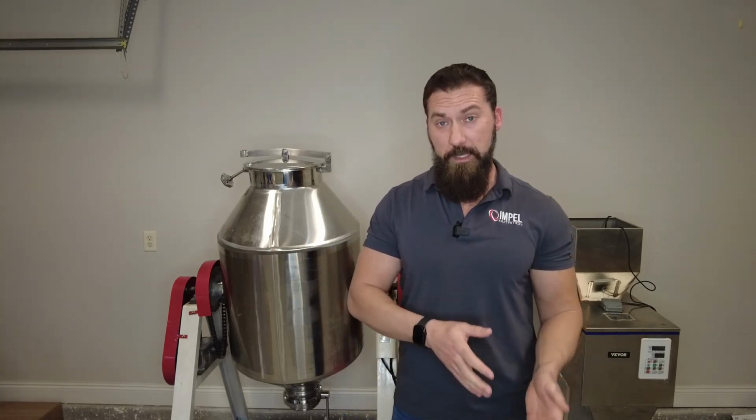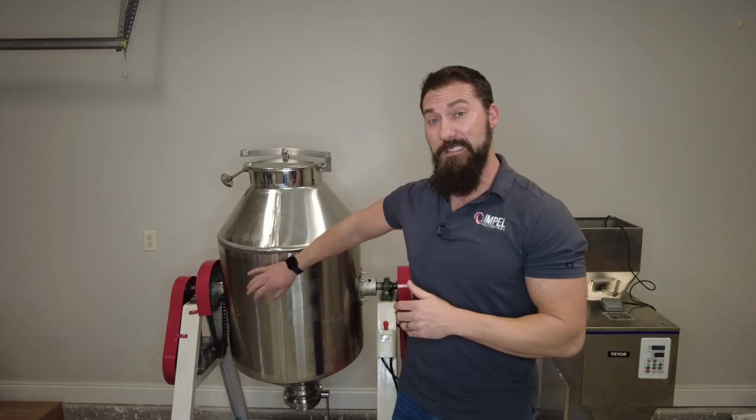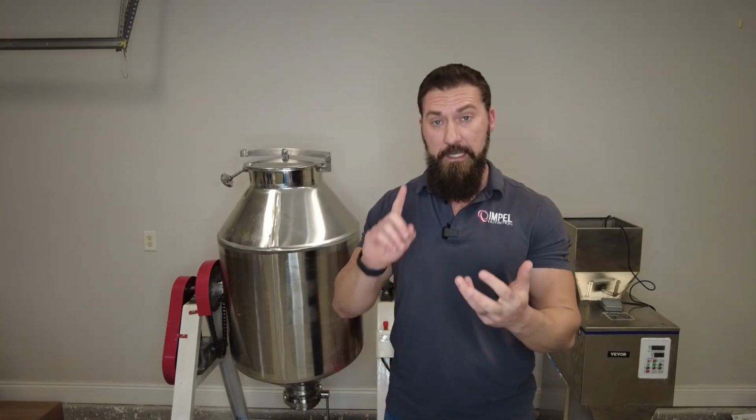So at a certain point, these particles become suspended in the air or break the threshold of gravity, holding it to the sides or the bottom of the drum mixer, allowing these particles to move freely throughout the mixture. Every particle, like I mentioned, has a different particle size. So the overall mixing speed, agitation, and overall mixing time are influenced by the particle size.